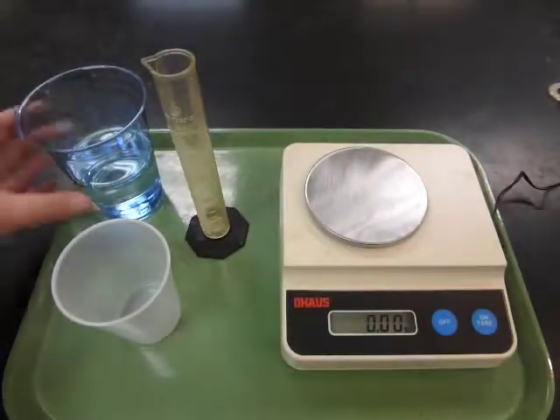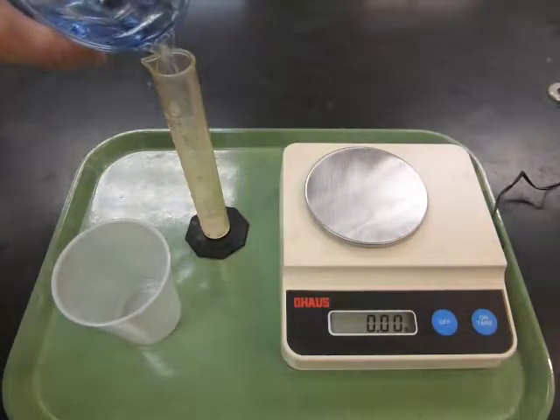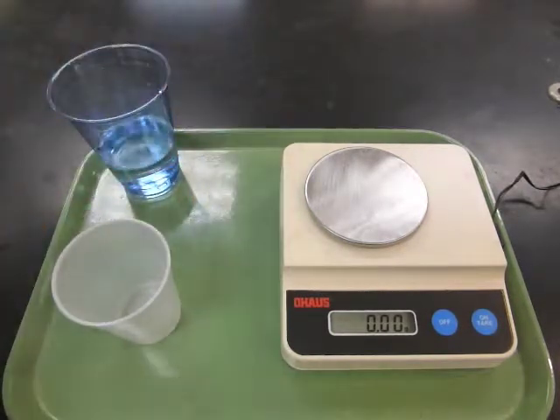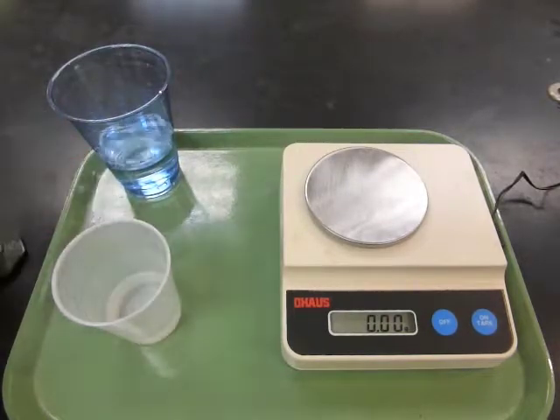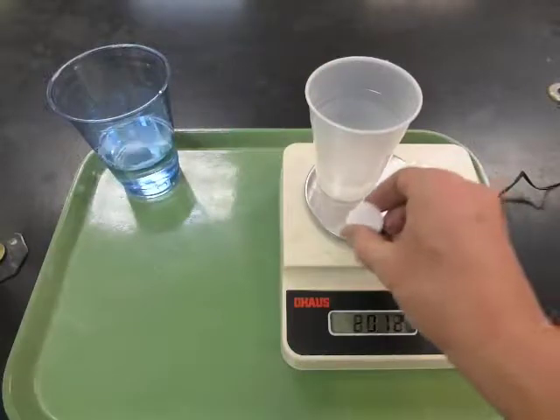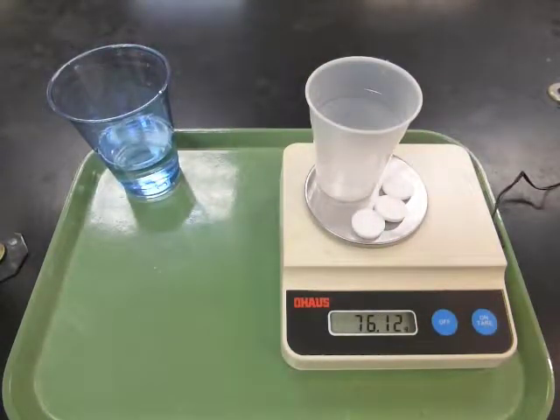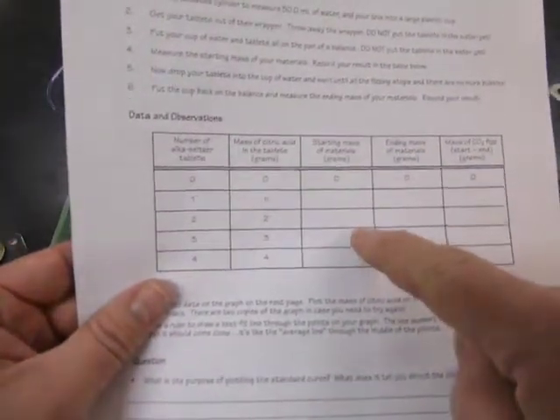You'll take some water and measure 50 milliliters using the graduated cylinder and put that into a cup. Each person will need their own cup with their own 50 milliliters of water. Then take your cup and however many tablets you're using — let's say I'm doing three tablets — put those all on the balance together, and record in the data table the starting mass of those materials.